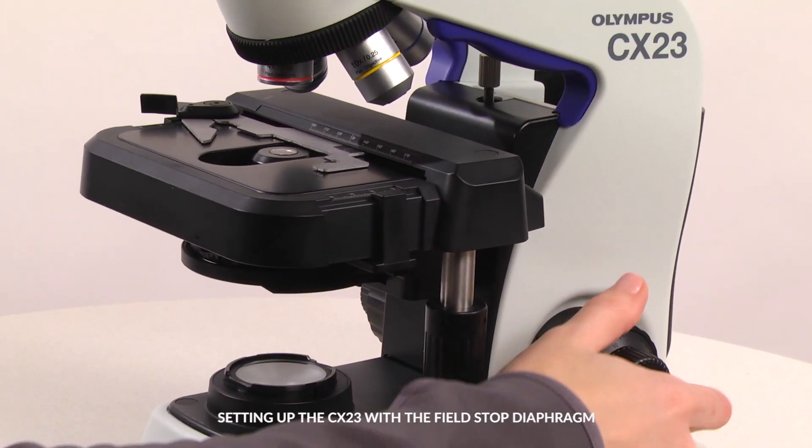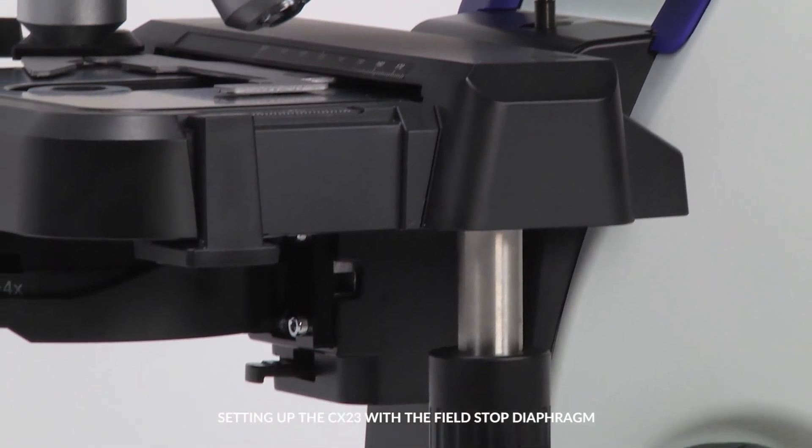First, raise the stage to its highest possible position. This will give you more space.